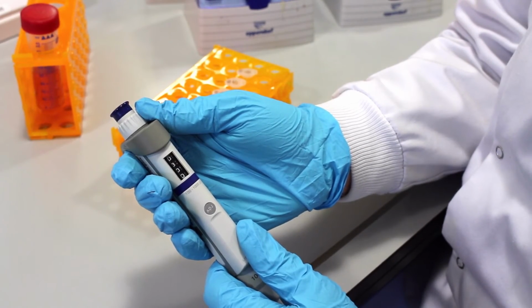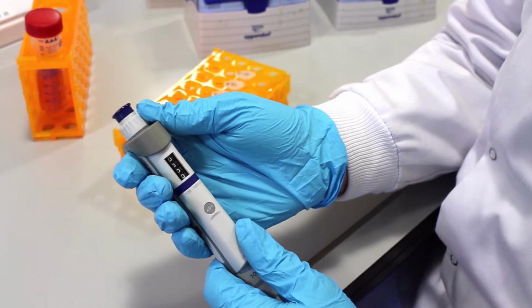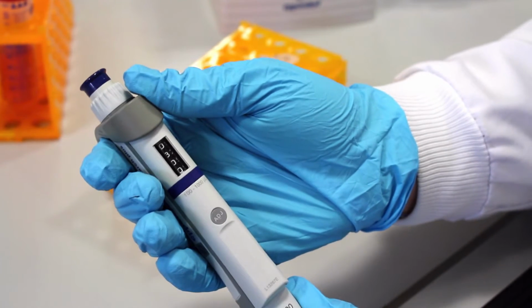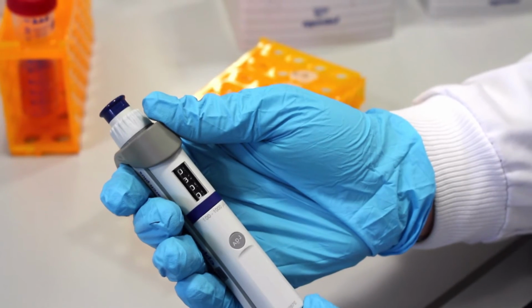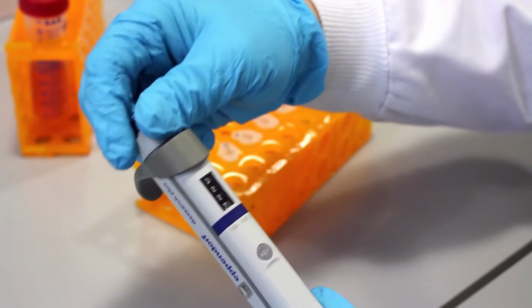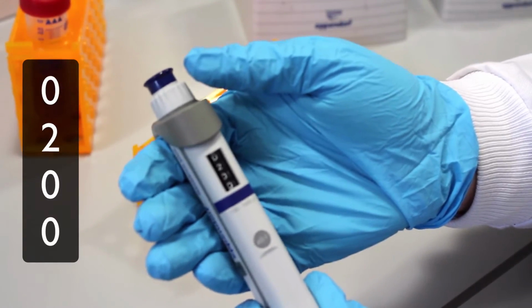In this experiment, the sample experiment, our required volume is 200 microliters, and we've selected the appropriate pipette as we've looked at the minimum and maximum volume capabilities of the pipettes available and selected the correct one. So as you can see here, it's set to 300 microliters, and we're going to go with 200. So I need to adjust the dial by twisting the lid slowly to get to 200 microliters. And now, as you see, the pipette is set to 200.